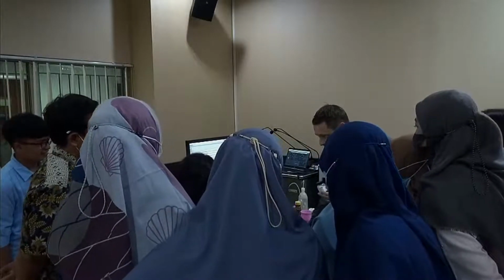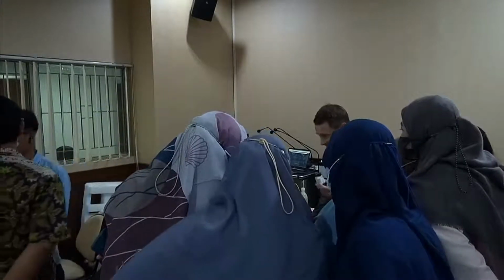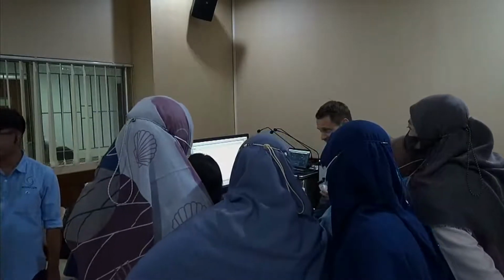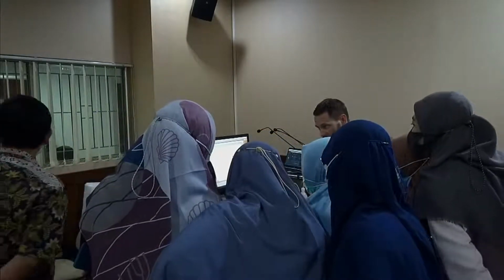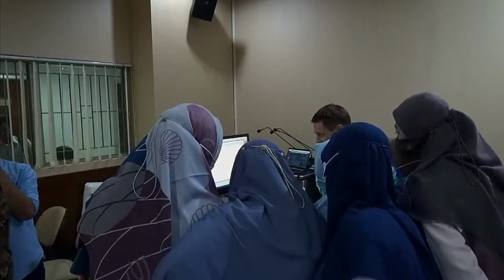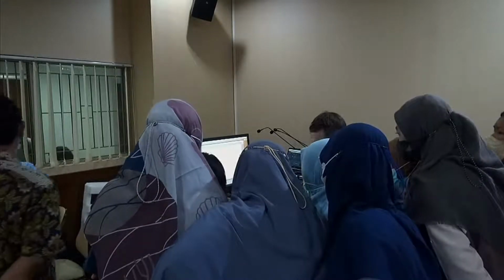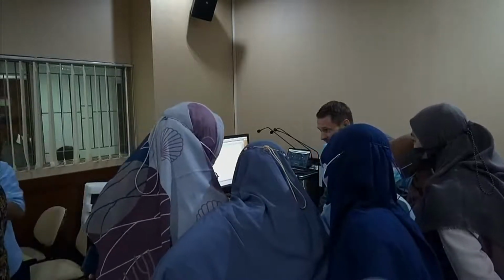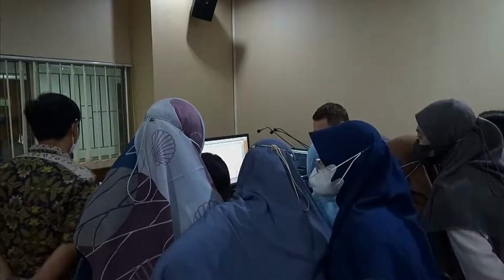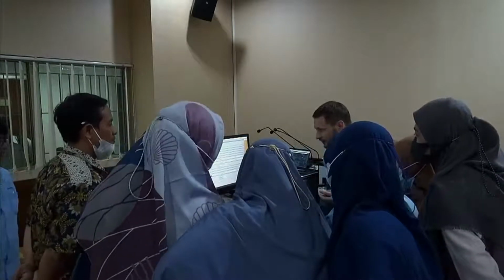As you see now, we need these parameter-specific values. In this case, it's very easy because for a lot of materials, we have an internal database with these values. Of course, you will always find something which isn't in there. But you see, the list here is just aluminium. So you see there, I gave an AL, and it shows me everything that begins with AL. So there is a lot of materials inside. In this case, we choose this one, it's corundum, and now it has automatically filled out the values.